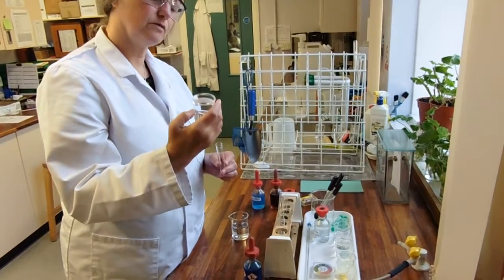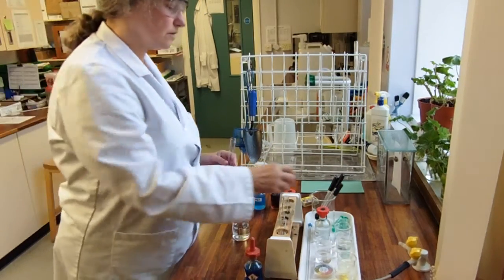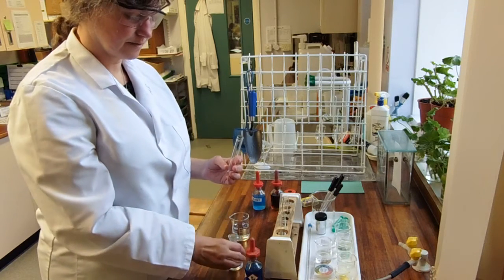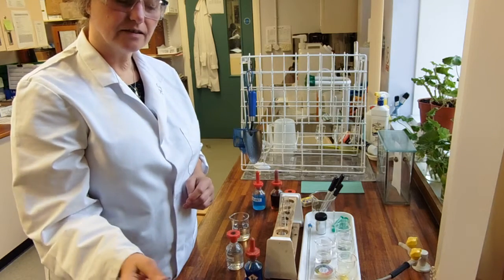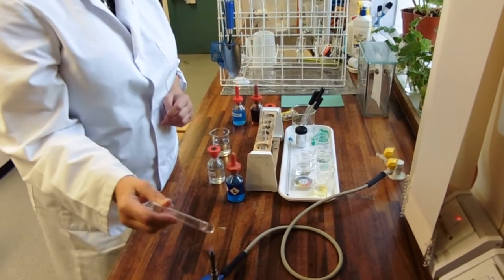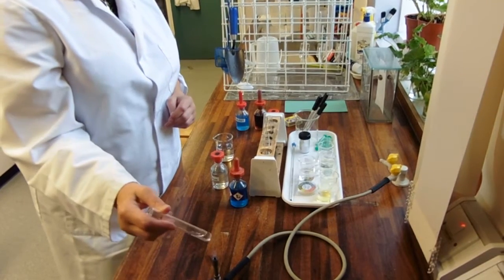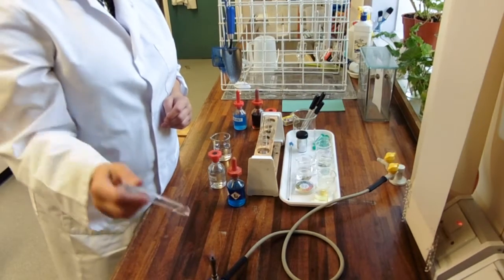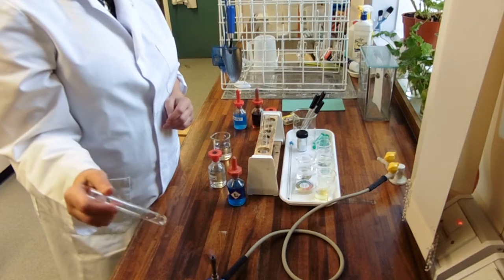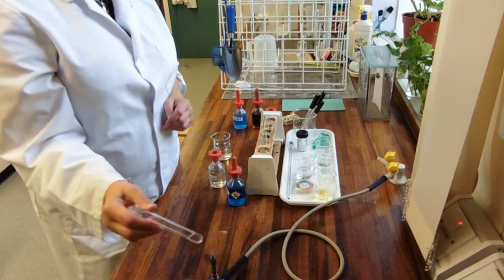Now this time, we're going to break down that glycosidic linkage that holds the sucrose together. And to do that, we could use an enzyme, but we're going to use acid instead. I'm going to use hydrochloric acid. I'm just going to give it a bit of heat. Again, in your instructions it says put this in a water bath. The heat will just help that reaction to happen. So, what is happening in the test tube at the moment is the hydrochloric acid is breaking the bond between the glucose and fructose. So, what I've got in here now is hydrochloric acid, glucose and fructose. Now, glucose and fructose are monosaccharides and that means their reducing groups are not being used in the bond. And because they've not been used in the bond, it should react with Benedicts solution.